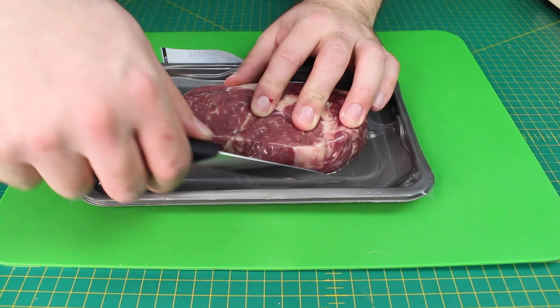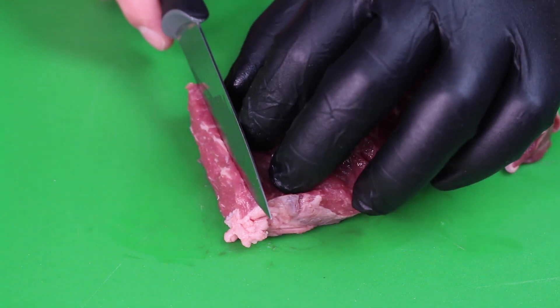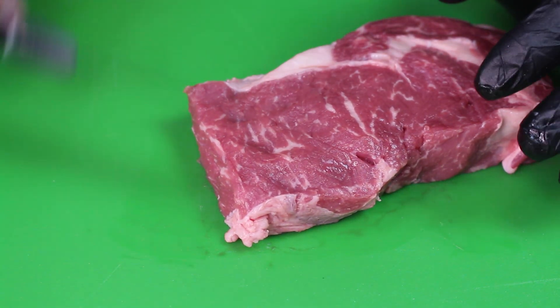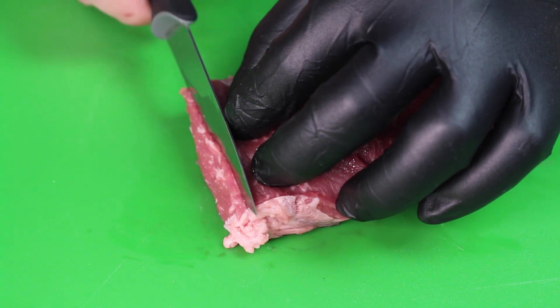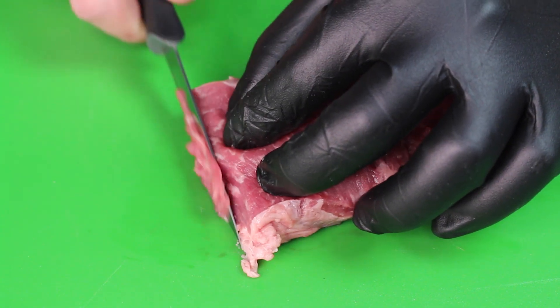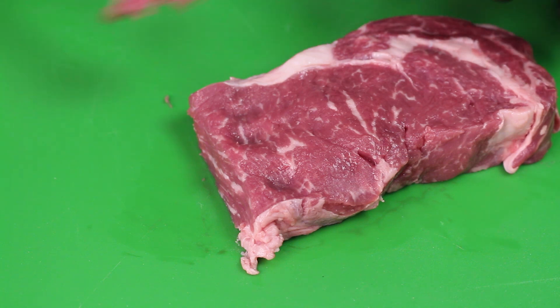Up next we're going to look at the difference between these two pieces of meat. They're both the same cut but the price difference is massive — about ten pounds here and about two pounds here. I want to see if under the microscope you can actually notice the difference. I suspect there'll be quite a bit of difference between the fat and the meat on each one. Let's prepare our slides — I want to try to get really thin slices, following the grain of the meat.